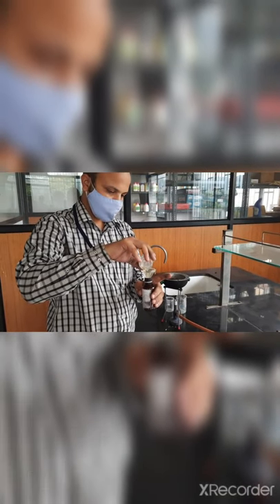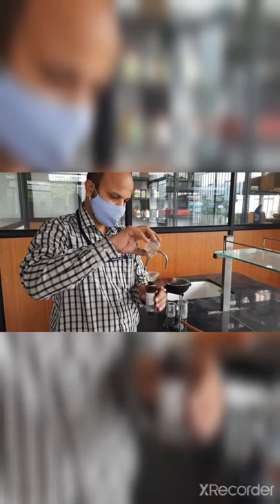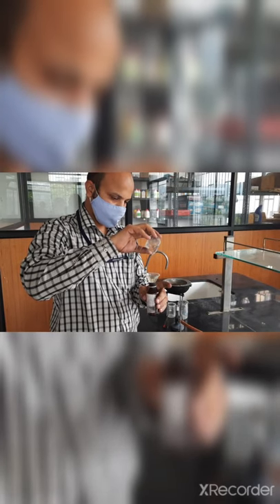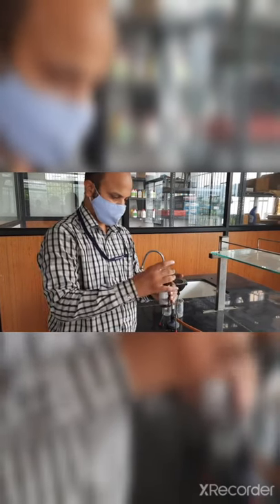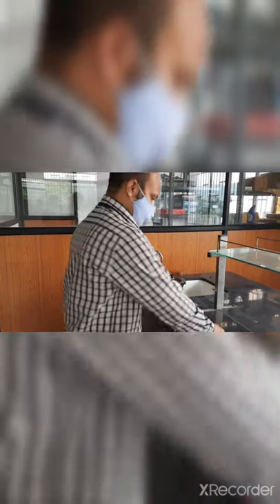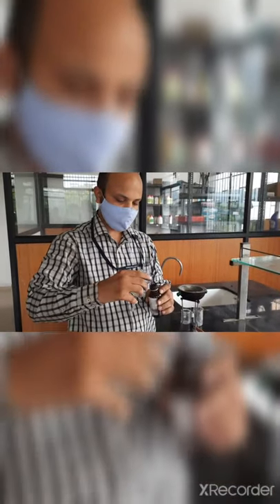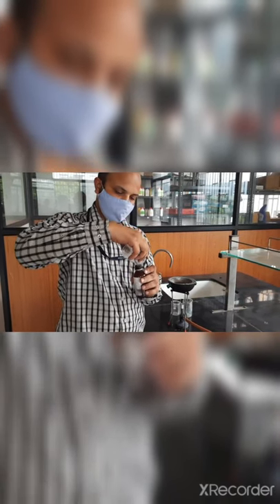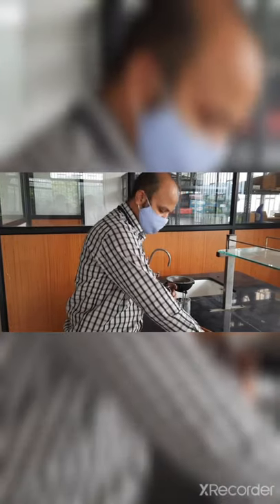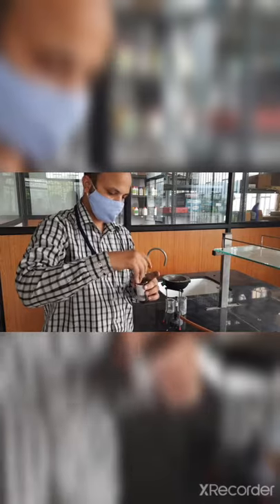The mixture is all clear liquid. I have measured the glacial acetic acid — this is the glacial acetic acid — and I am mixing it in. I am adding it now, then closing the bottle and shaking.